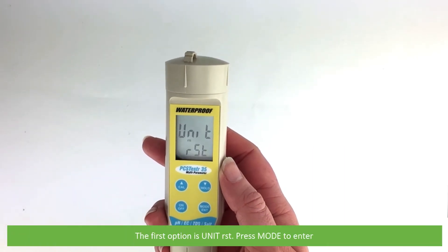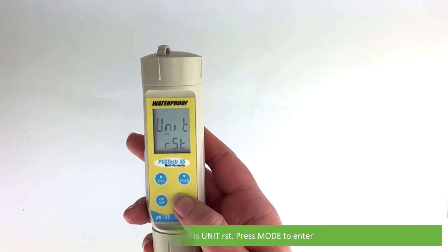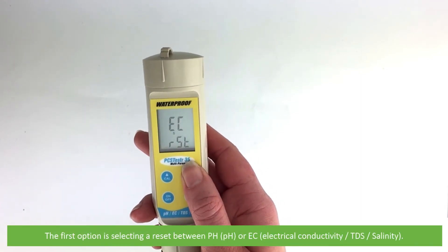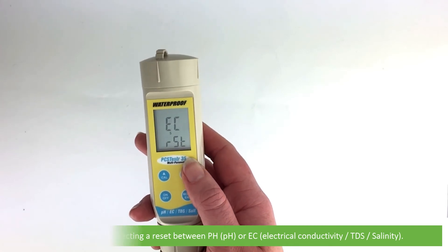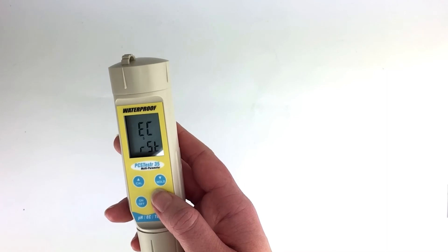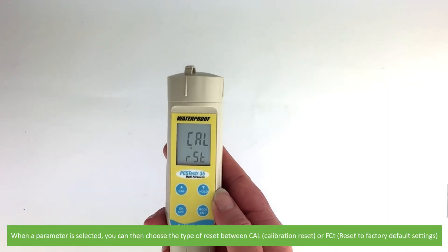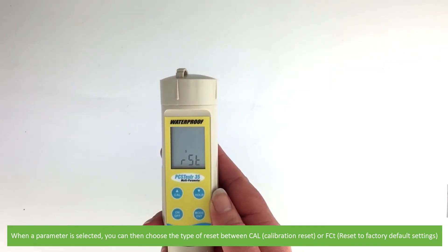The first option is unit reset. Press mode to enter. Within reset, the first option is selecting a reset between pH or electrical conductivity, TDS and salinity. When a parameter is selected, you can then choose the type of reset between calibration reset or reset to factory default settings.